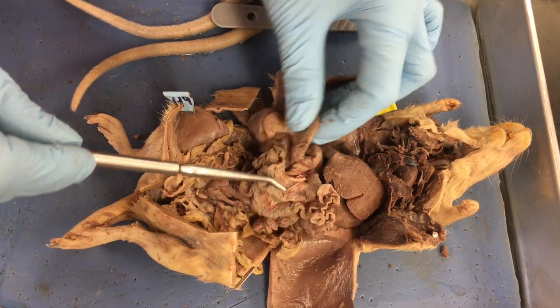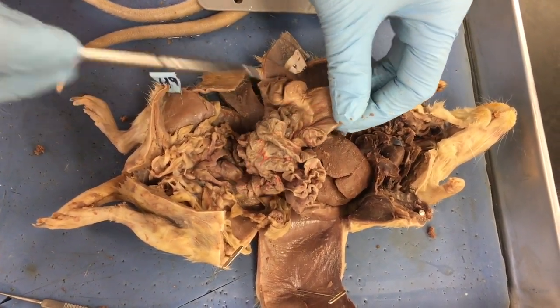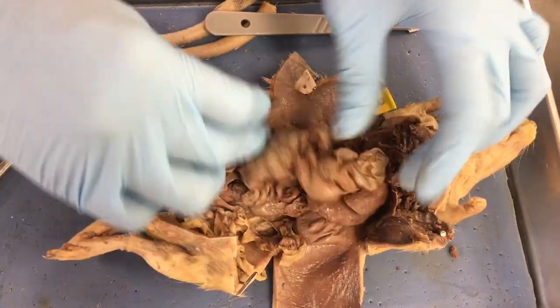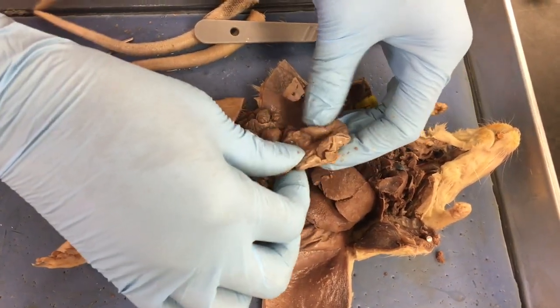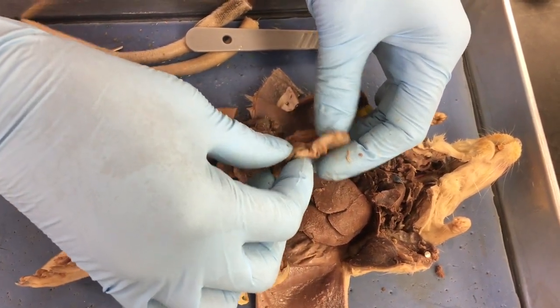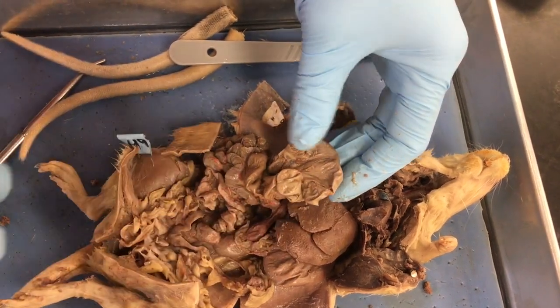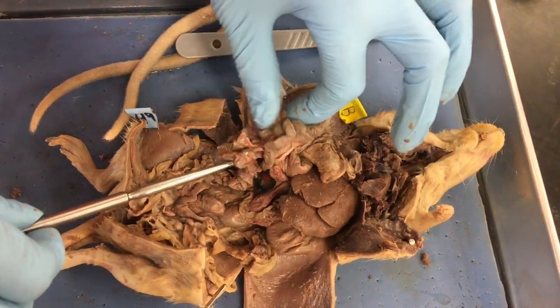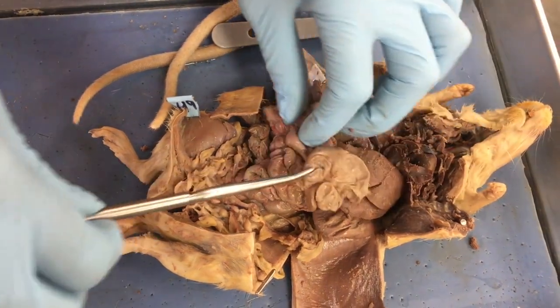Now, as we get over here, notice how the diameter of the small intestine, or the intestines, gets larger. So we have a larger diameter there. So now we're getting into large intestine. So large intestine, large intestine. And then we have this kind of sackish type structure here. This is the cecum. For rats, because they can eat all types of fibers, they have a bacteria in their gut that breaks down cellulose. So their cecum is much more pronounced than ours because they have a larger amount of bacteria in there. So small intestines, cecum, large intestines.